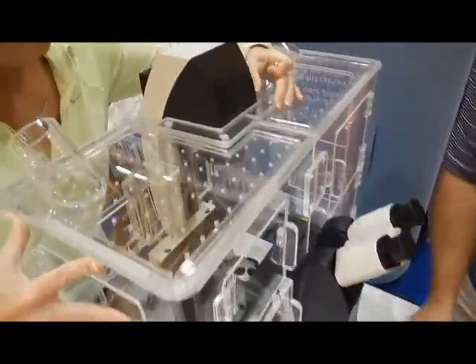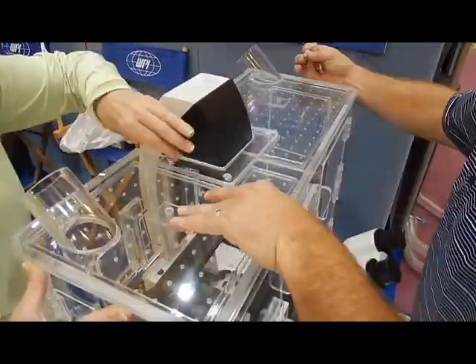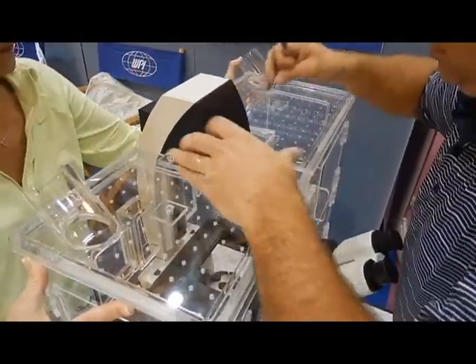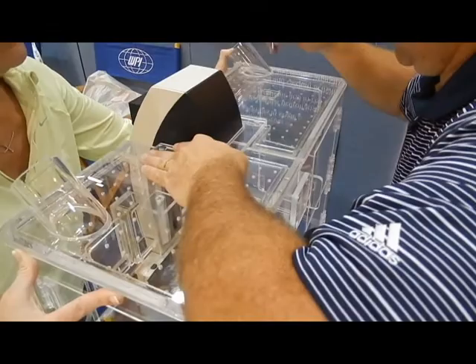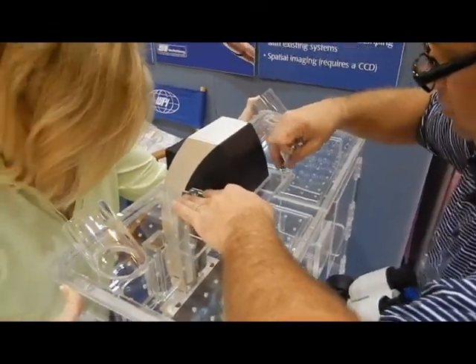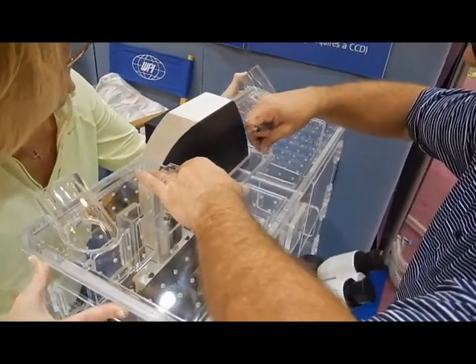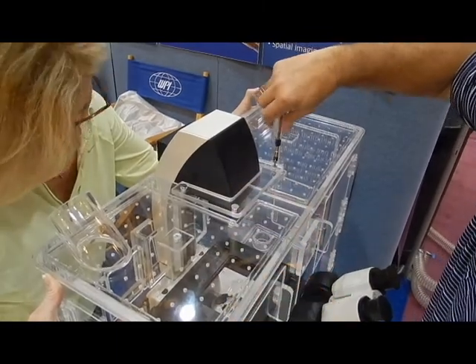Position the top connector plate and insert the screws. When all the screws are in position, then you can tighten them. It helps to have one person holding the two halves of the chamber together while you tighten all the screws.